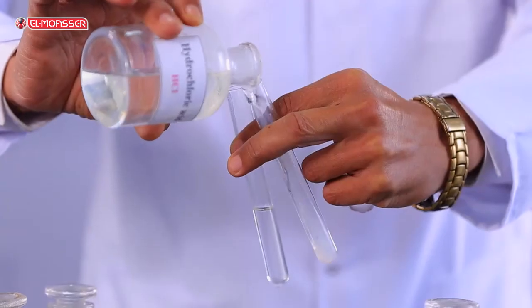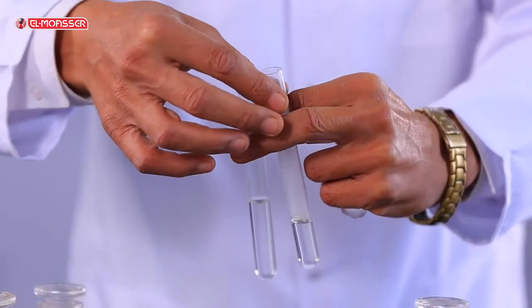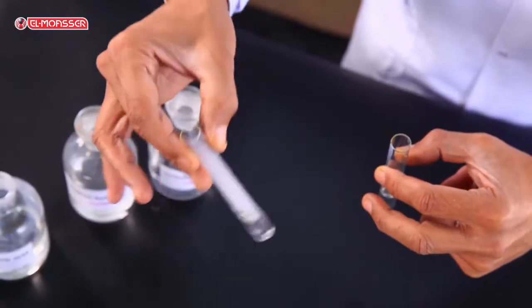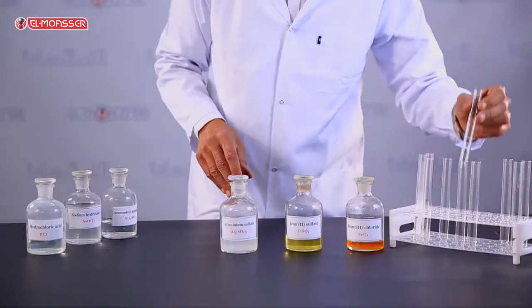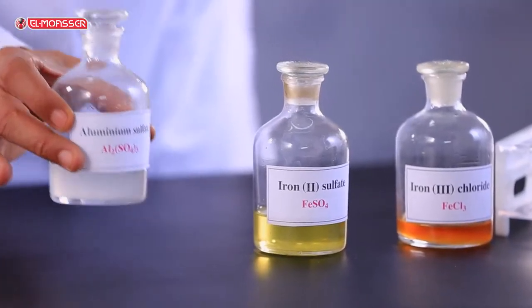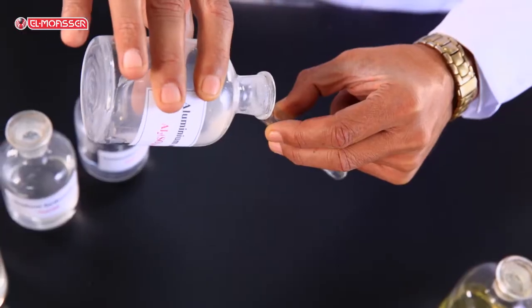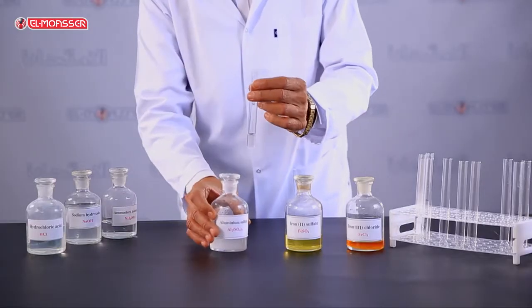Add diluted hydrochloric acid to the second test tube. The aluminum hydroxide precipitate is also soluble in diluted hydrochloric acid.